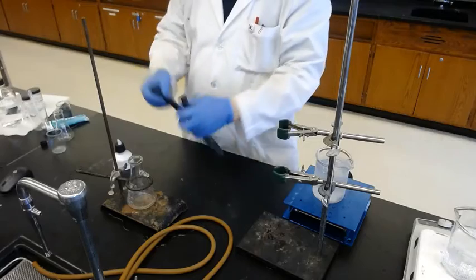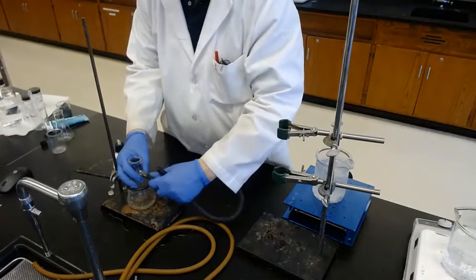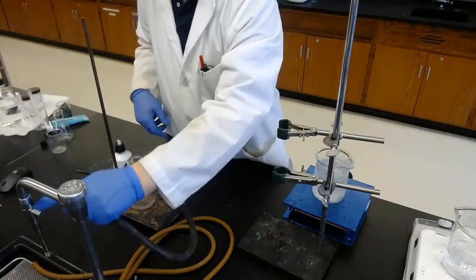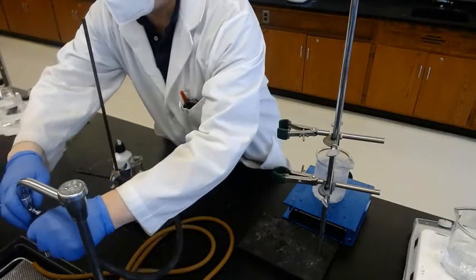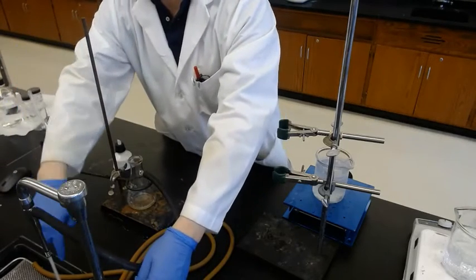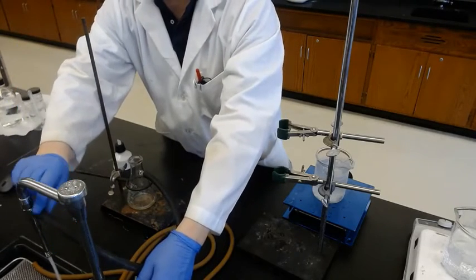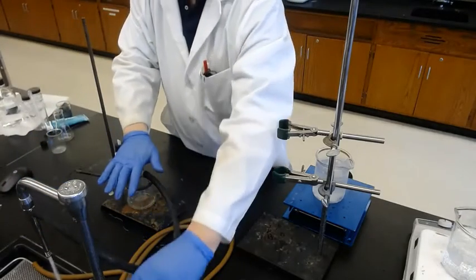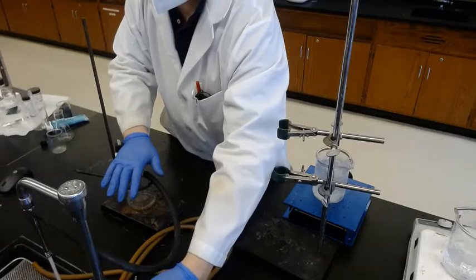Connect the water tube, one to the side, one to the side of the water tap. So when you turn it on, water moves down, and it's sucking the air from the side together, which is connected to the vacuum, the plug. So open it all the way.